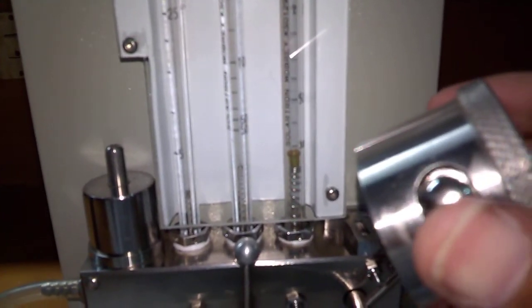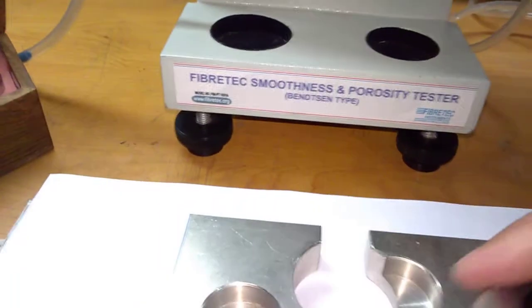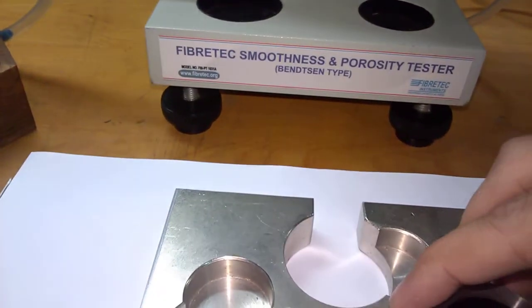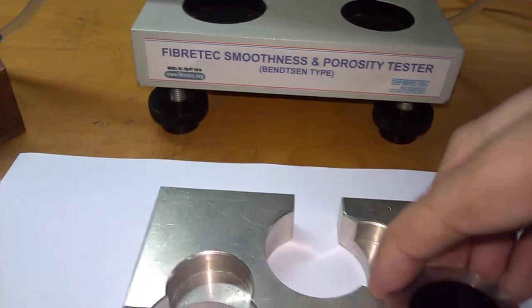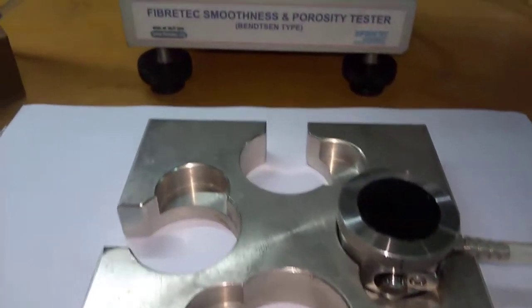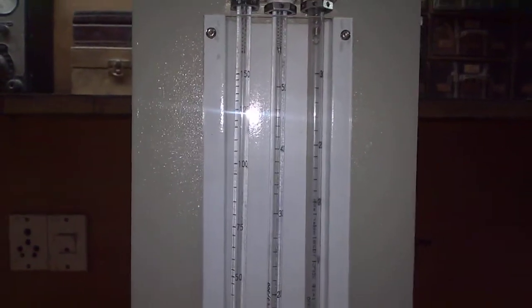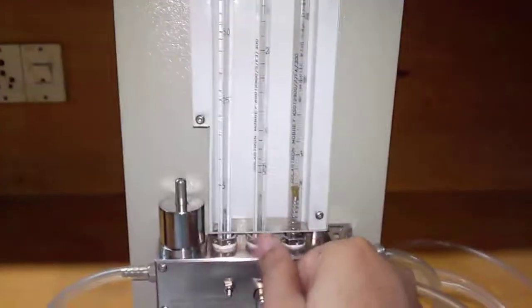I am releasing this knob. When we press here and release it, we can have the values. This paper is going above 500 ml per minute, so we can choose a different selector position.